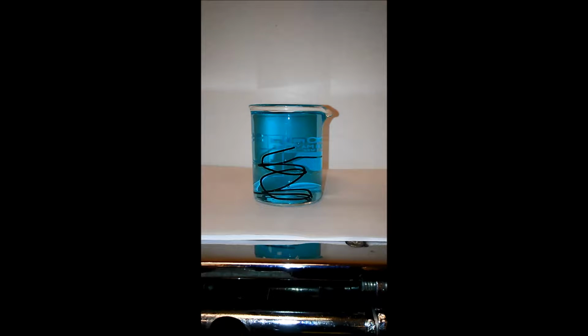So while that starts to react, we're going to do the reaction equation up here. So iron metal, of course, is simple, Fe. And the metal part, we're going to note with an S for solid. Reacts with copper-II nitrate solution. I suppose I'll stick with the red color for that. But copper-II nitrate, copper, Cu, the 2 tells us it has a 2+ charge.